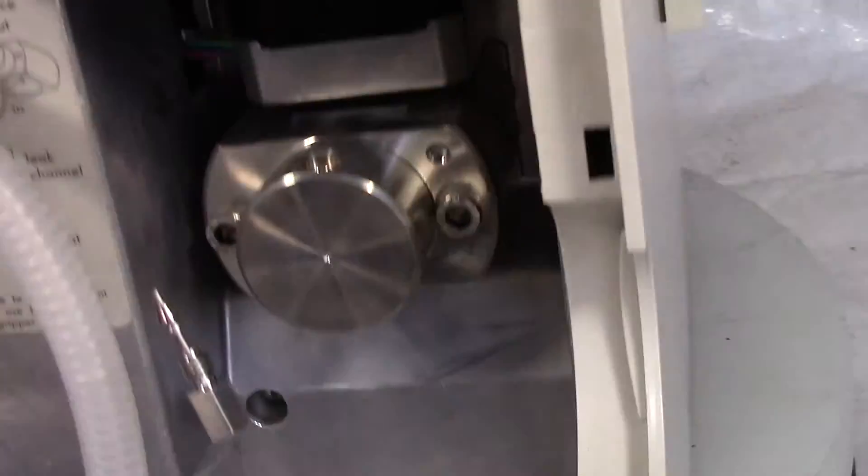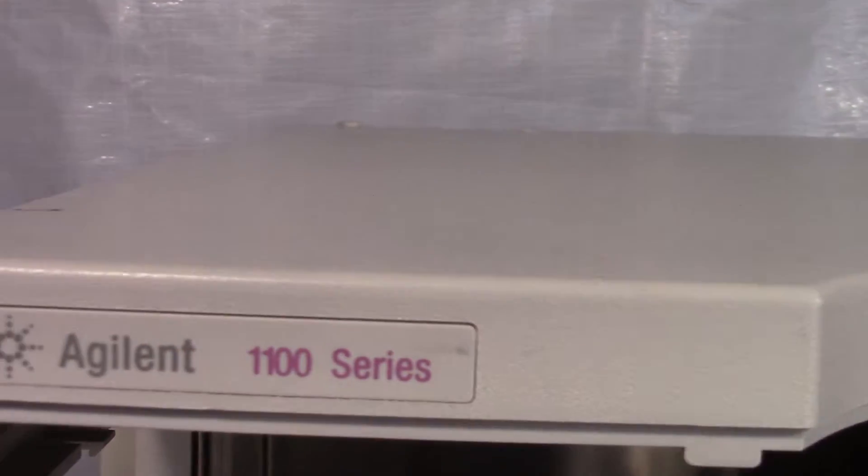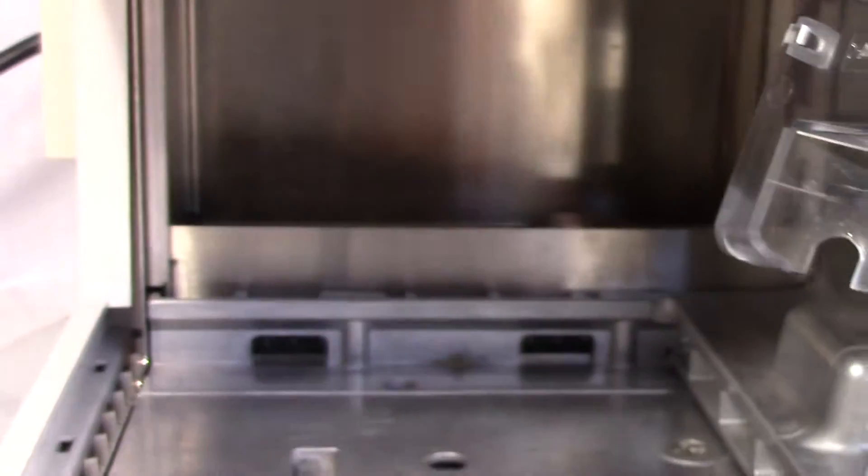It can be removed. It is an Agilent 1100 series. Power the unit off.